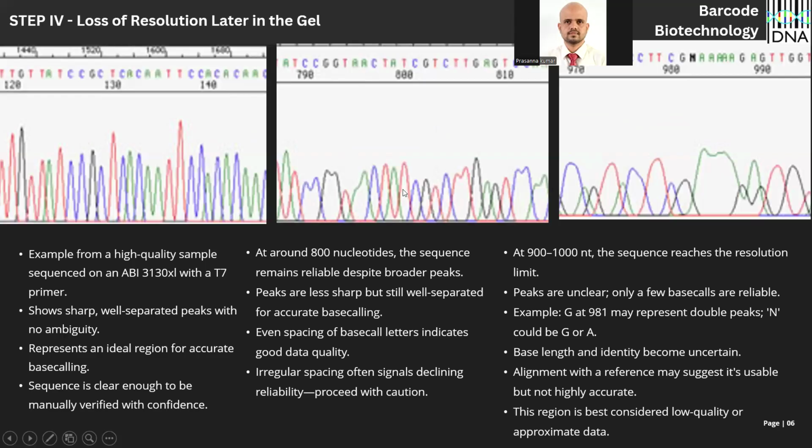Okay, if you cannot make a base call, something like this, see here, we have only two prominent peaks of adenine, but see how many adenines have been called. So when you cannot make a guess, even though they could be called G, they are called N. So usually you will see such a problem compounding at the later part of the chromatogram. If you cannot make a call, I would say stop at around 800. After 800, just delete it. You cannot make a call, so till 800 is fine.